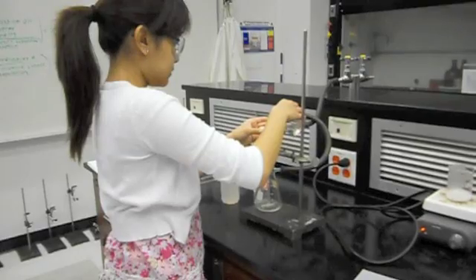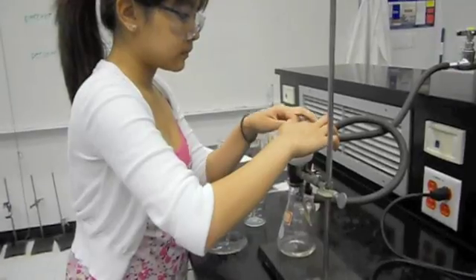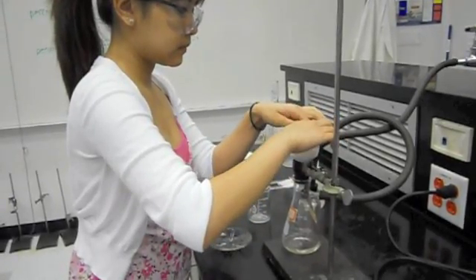Once the filtration is complete, place the filter paper with the residue on an evaporating dish with your initials on it and bring it to your TA to place in the oven.